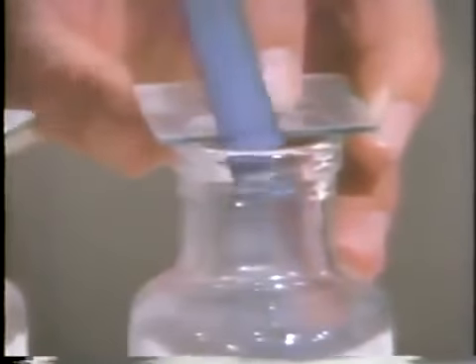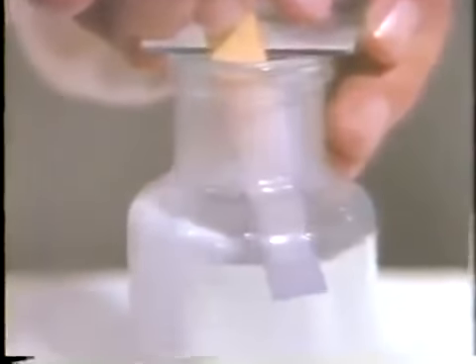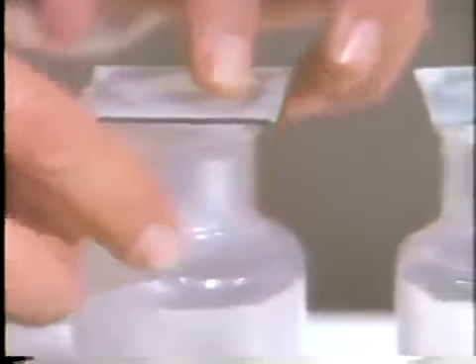The dye color changes dramatically. When the dye goes into hydrogen chloride, the color change is reversed. Thus, bromcresol distinguishes these two gases.